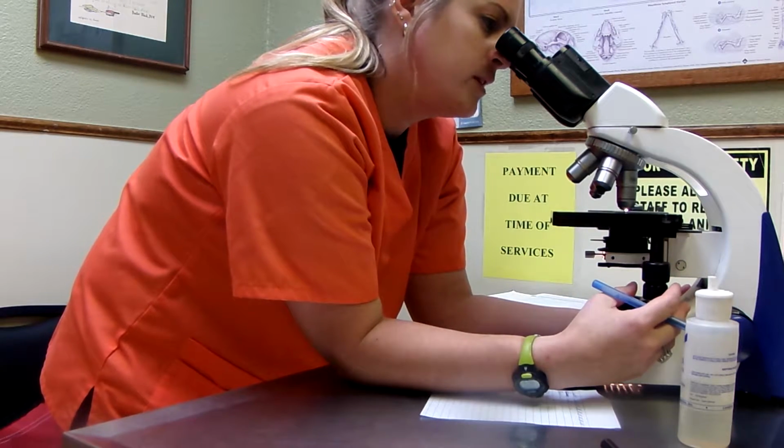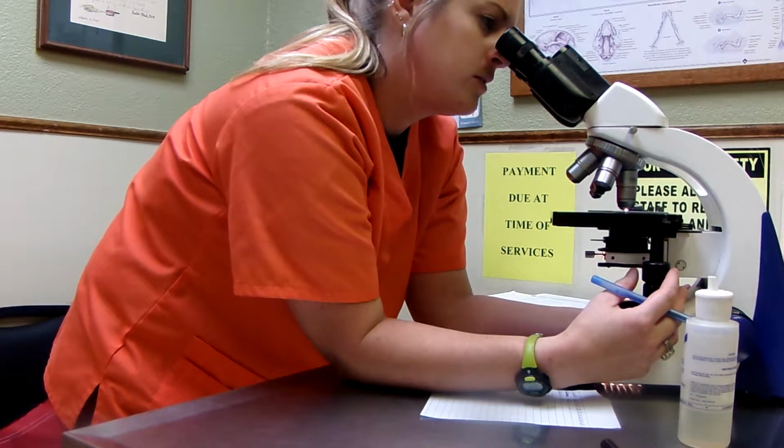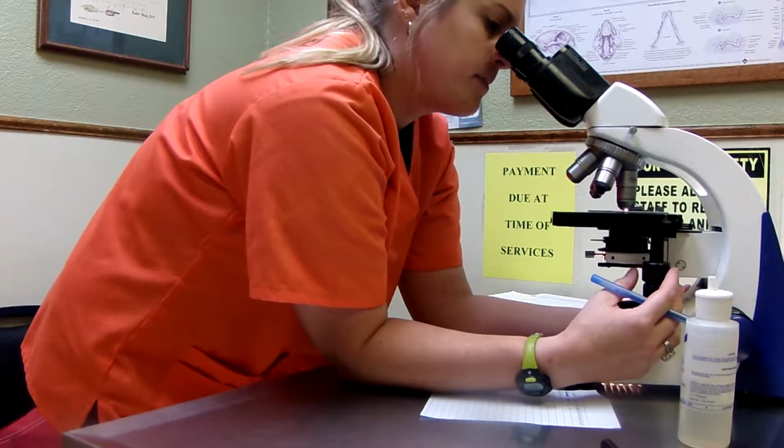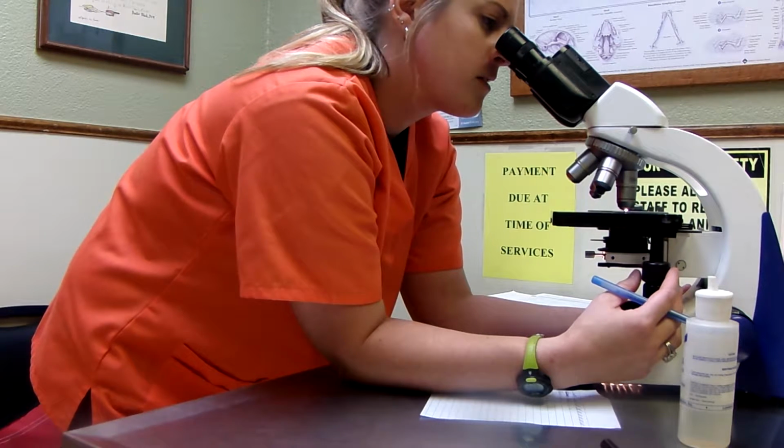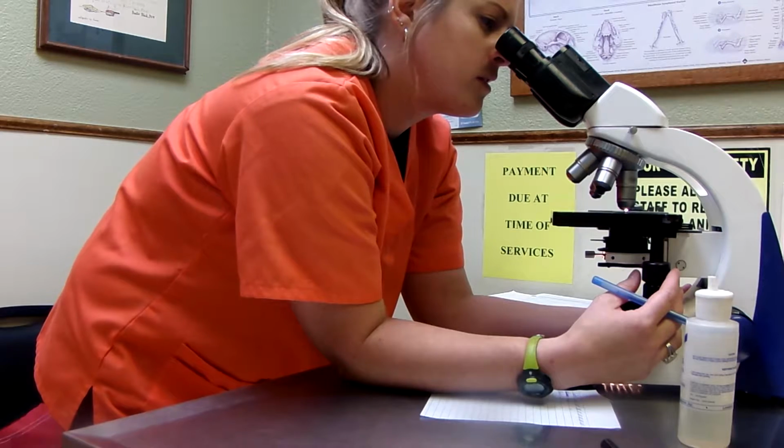About 40 more to go here. 1, 2, 3, 4, 5.